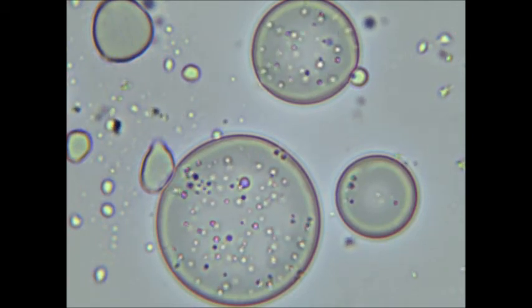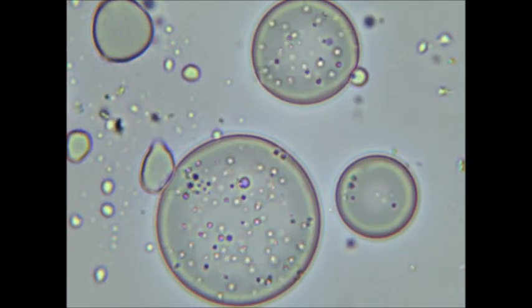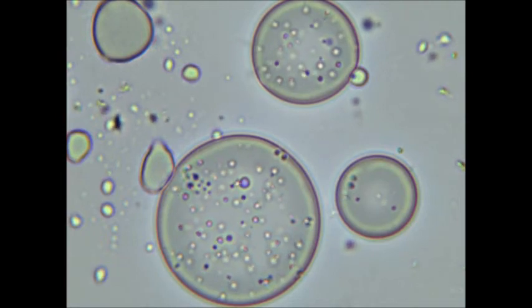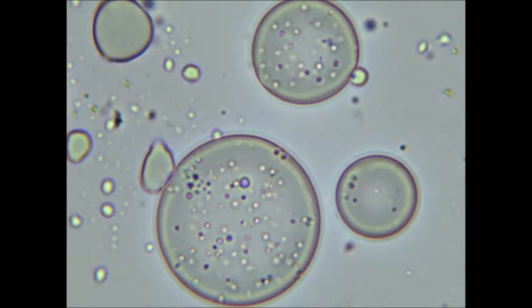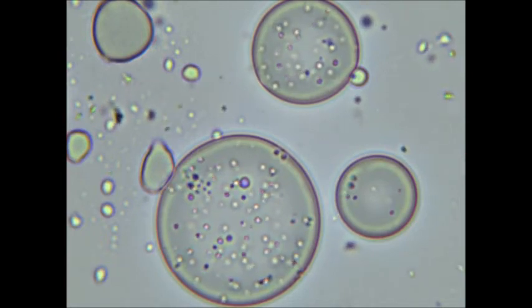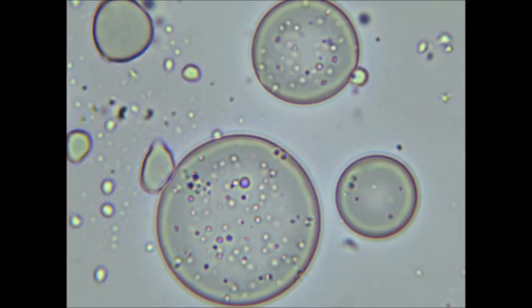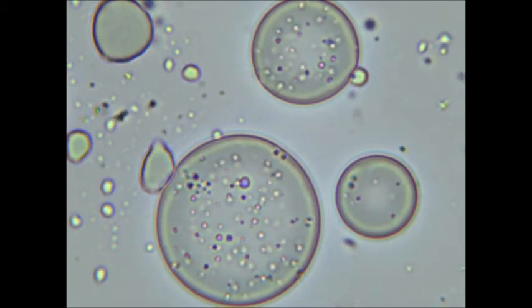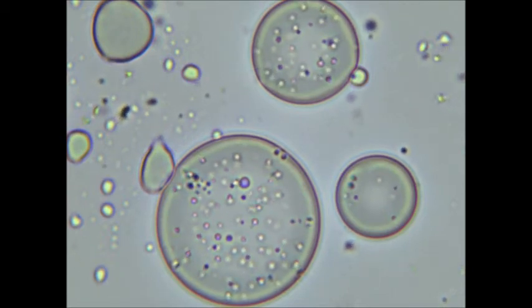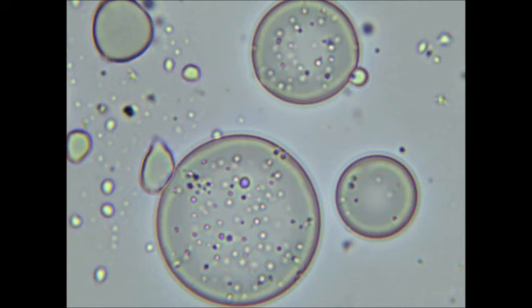The video that you are watching right now is a video of fatty acid vesicles under the microscope. Dr. Shostak seems to think that fatty acid vesicles like these were the first primitive cell membranes.